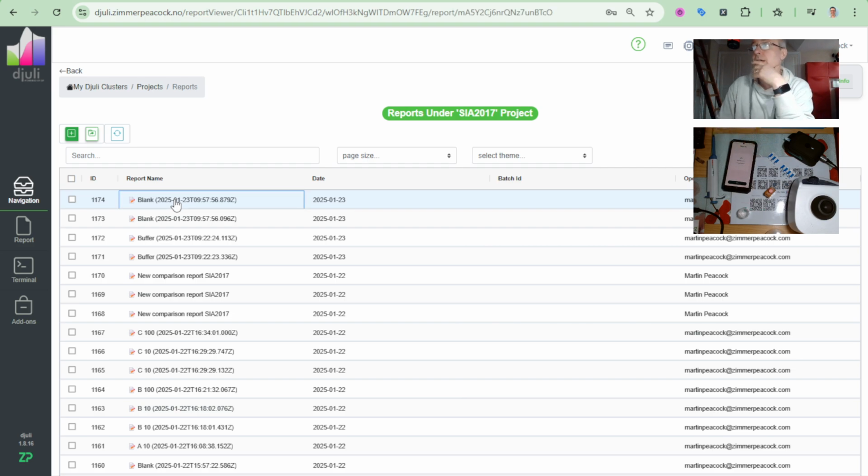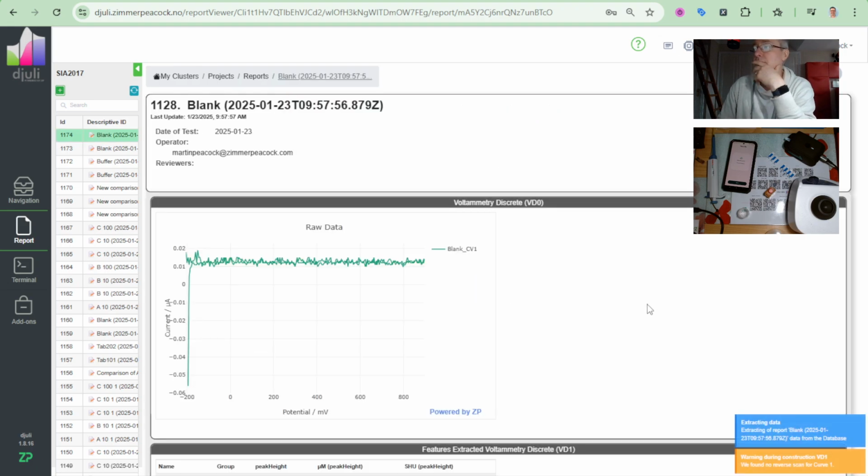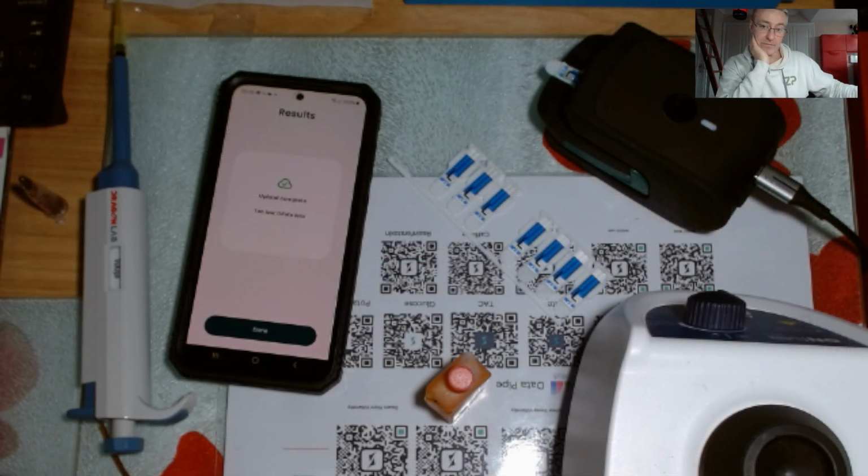So I'll go up there and check on myself. I was like, oh, that's a bit weird. Let's have a quick look at what's going on here. Well, that's weird. Now this time round the client hasn't done this, but look at this. I did this on purpose, and I just want to give people a heads up so they don't do this. But I have noticed in the past this particular client has done this. I put the sensor in there, but I didn't close it. The client hasn't done this now, but I want to give people a heads up that you may do this when you see your data like that.